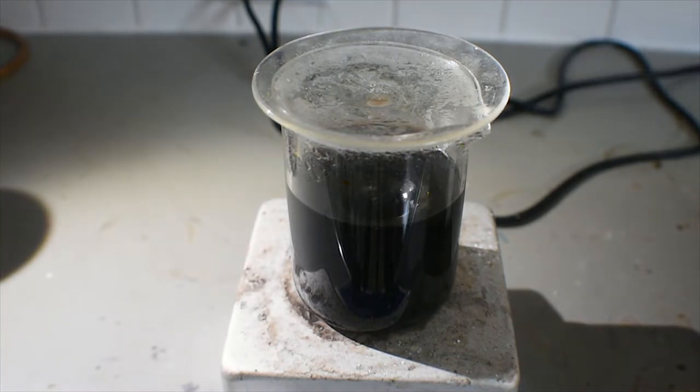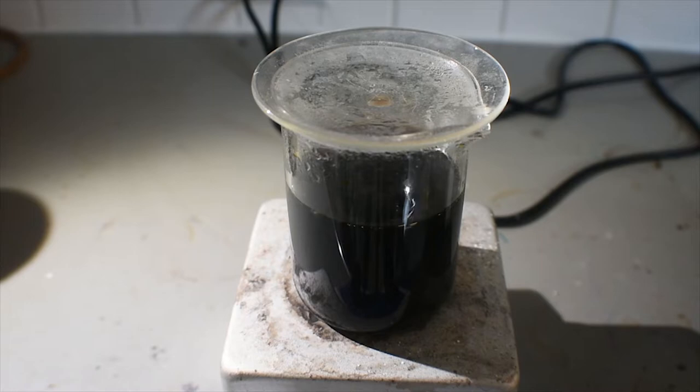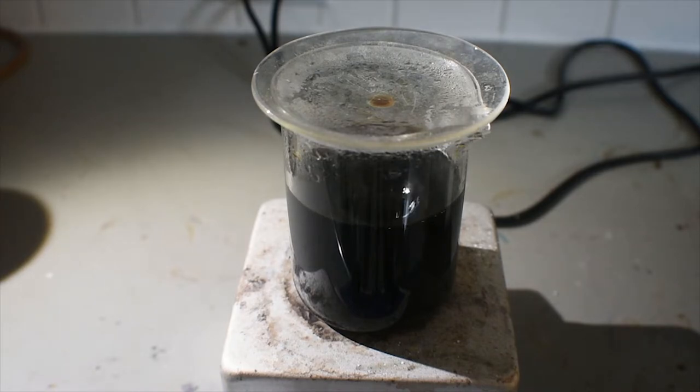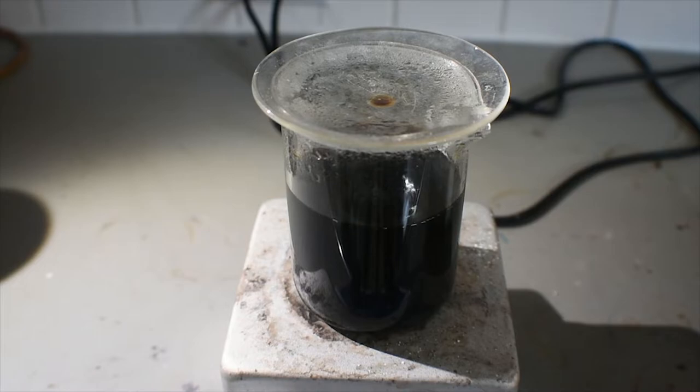Okay, now I'm just going to let this sit and react for probably about five minutes. Then, I'm going to switch on the hot plate to low and evaporate the solution down to one-tenth of its volume. That'll be around 16 or so milliliters because we have 160, roughly, milliliters of solution here. So, after this is done dissolving and after all the chromium-6 is mostly reduced to chromium-3, I'm going to go ahead and start the heat.